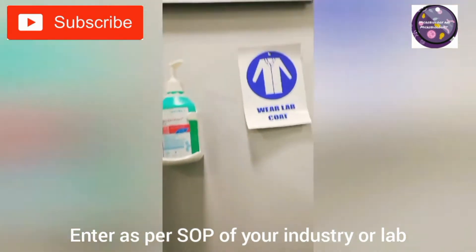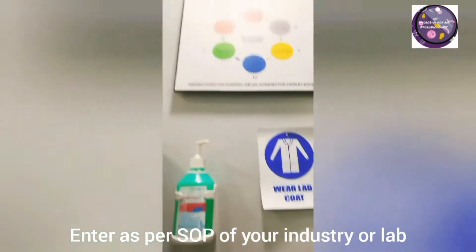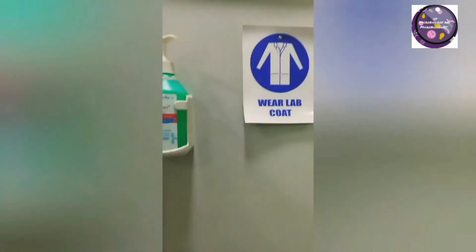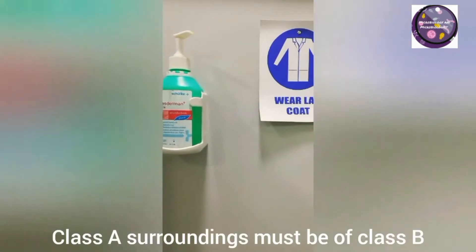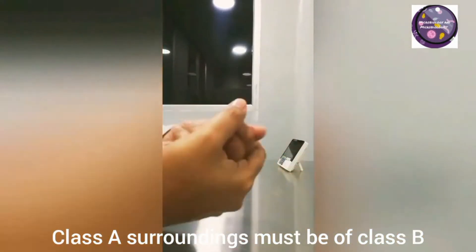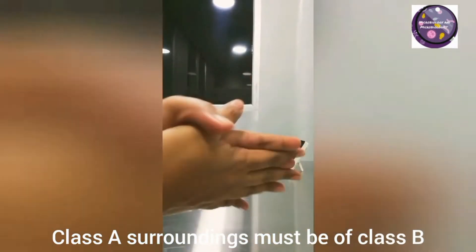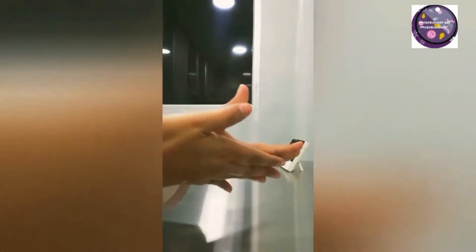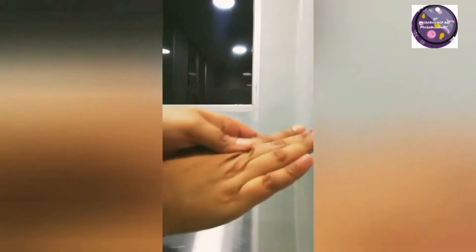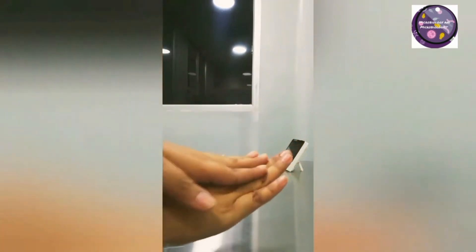Use sanitizers and wear personal protective equipment (PPE) as per SOP before entering into the Class B area. Class A surroundings must be of Class B.